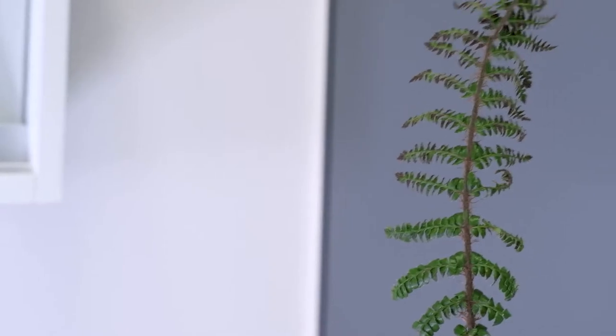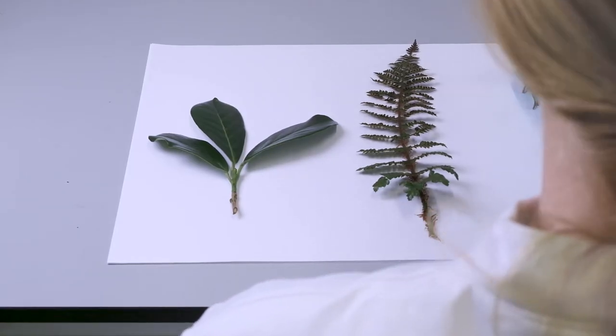You choose your leaf, which leaf you want to use to answer your research question, and you take it to the lab.